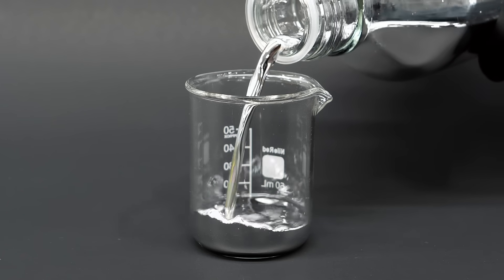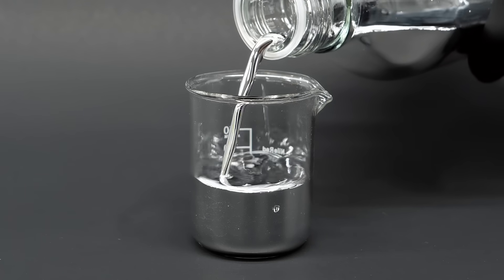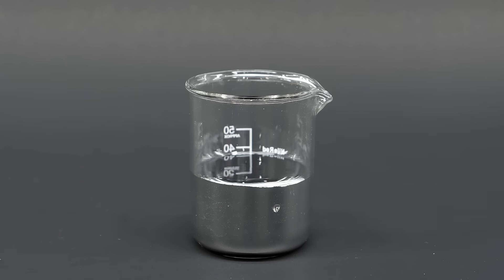This is a bunch of nice and shiny mercury metal, and I'm gonna use it to do something that I think is kind of magical.